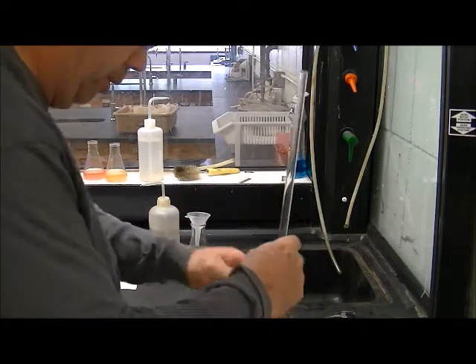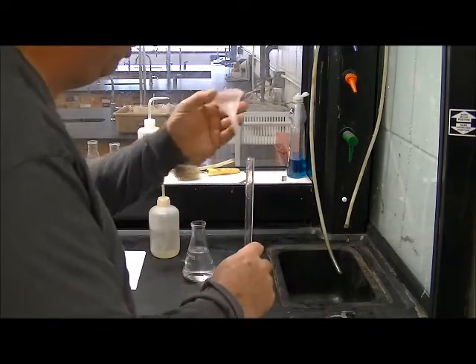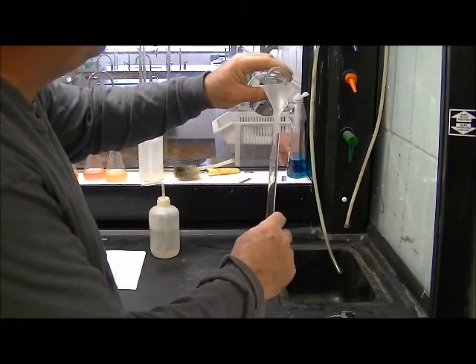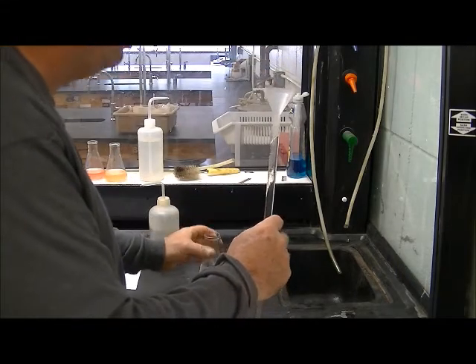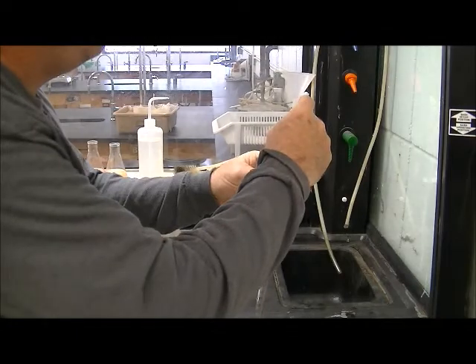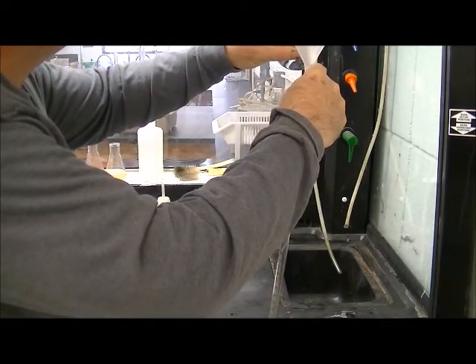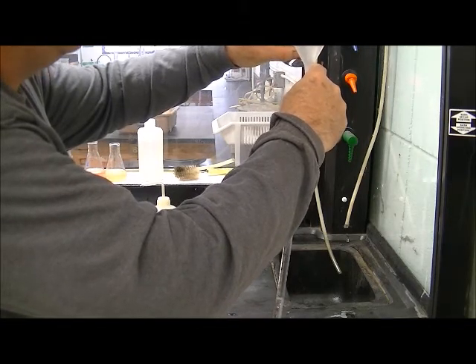Once that happens, that valve is closed, I'm going to fill the burette up just above the zero mark. Trying to stop on that zero is difficult so if I plan to fill up a little bit above it I can adjust it downwards and get right on that zero.